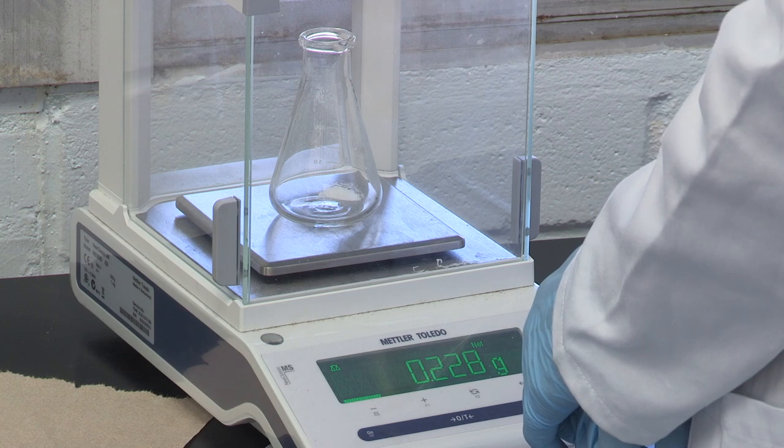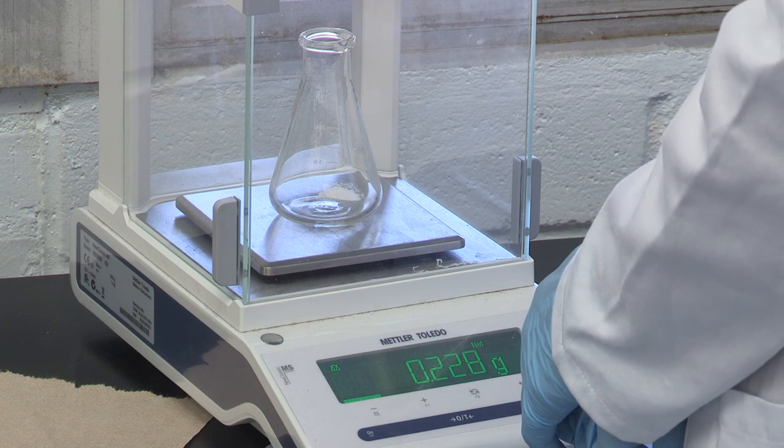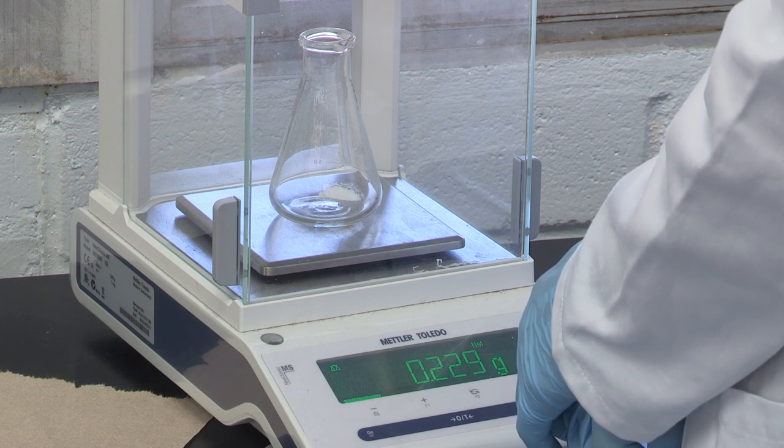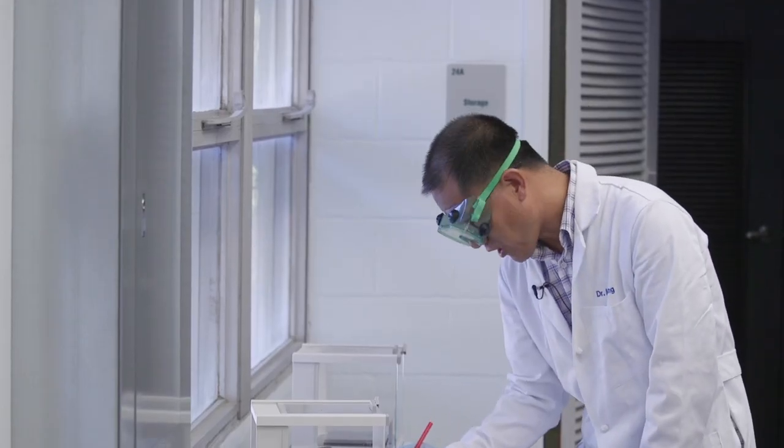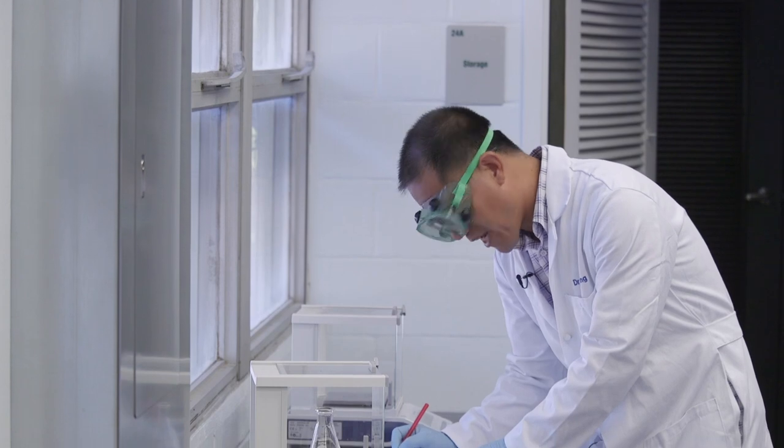Now, we get 0.228. It's a little over 10 percent. It should work. Remember, we need to record the mass immediately after the measurement.